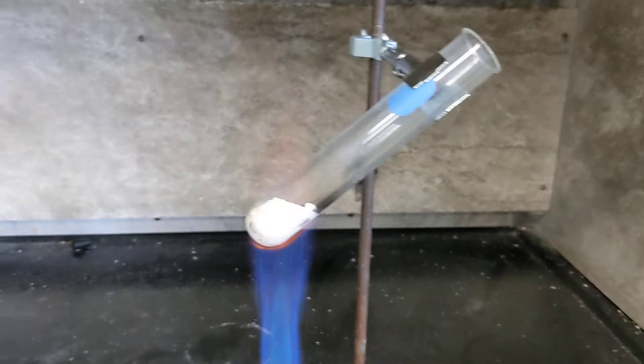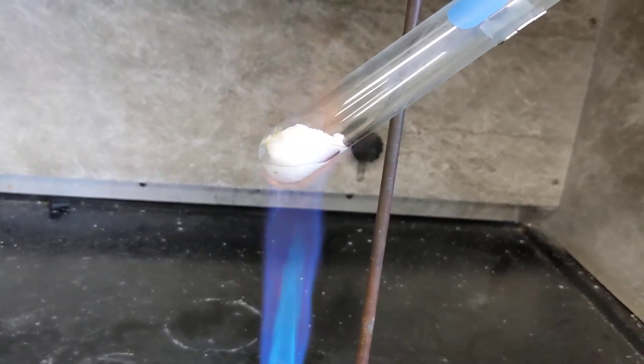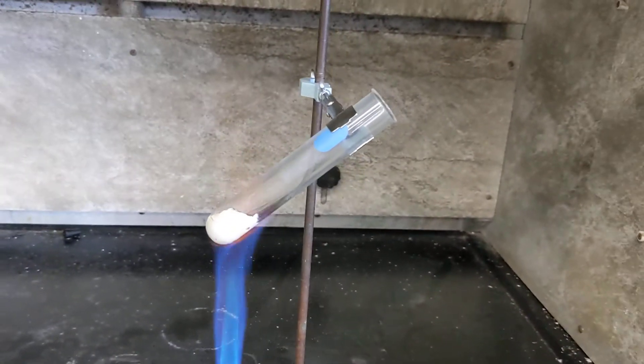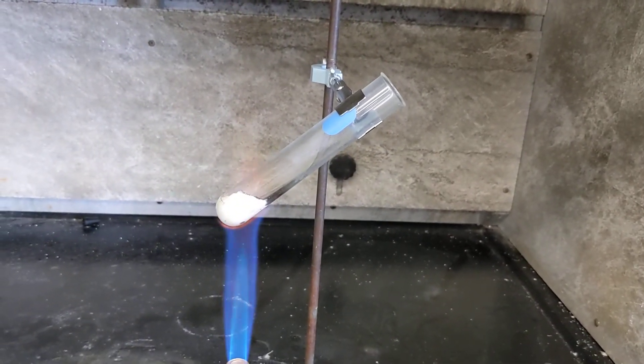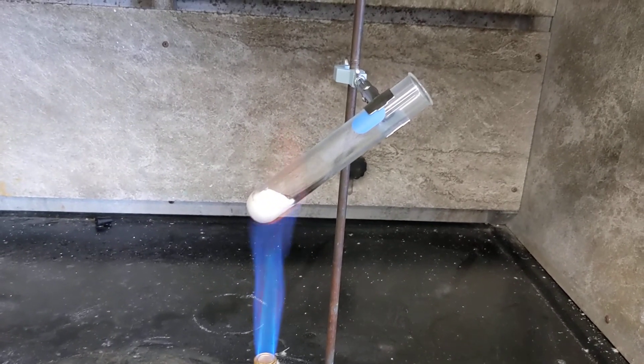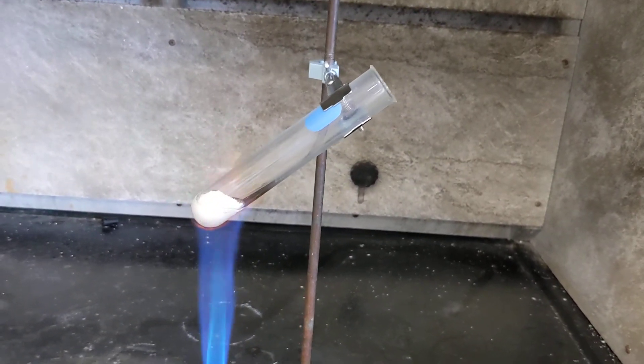But we'll get this completely melted. So molten potassium chlorate. Almost there. Sorry, this is not the most exciting part.